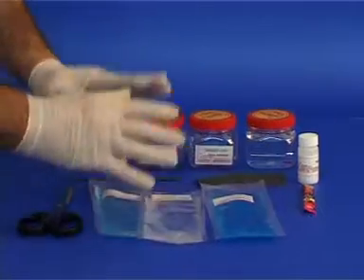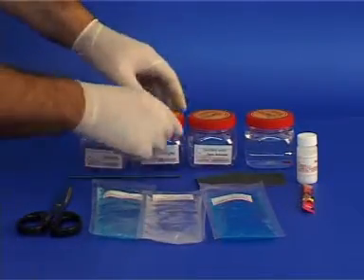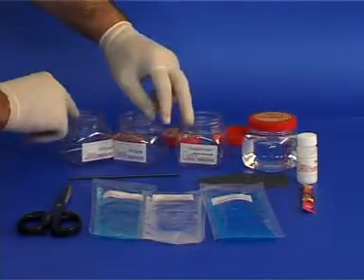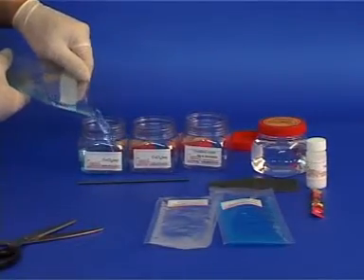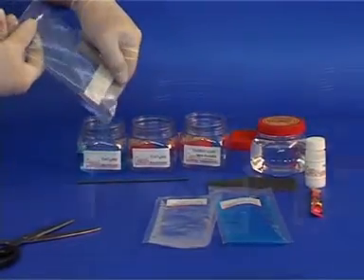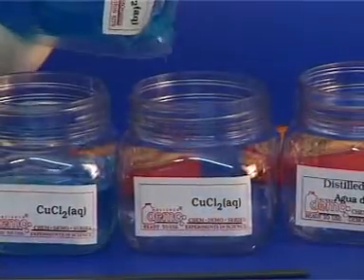Let us open the containers. Cut open the bag with a dilute solution and transfer its contents to the appropriate container. Repeat the procedure for the other bags.